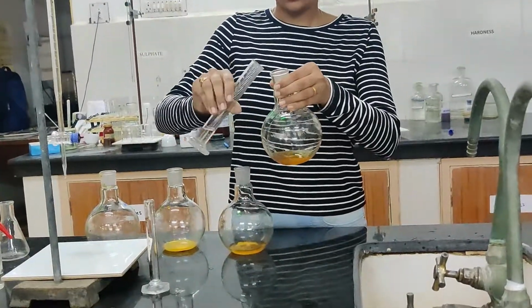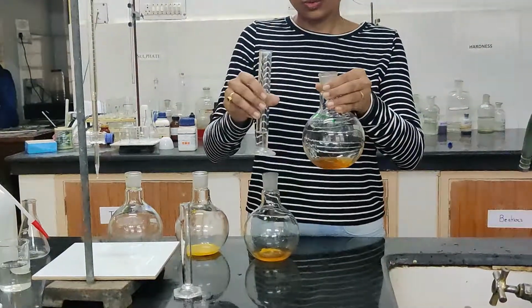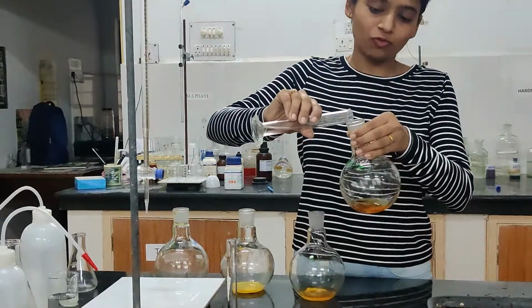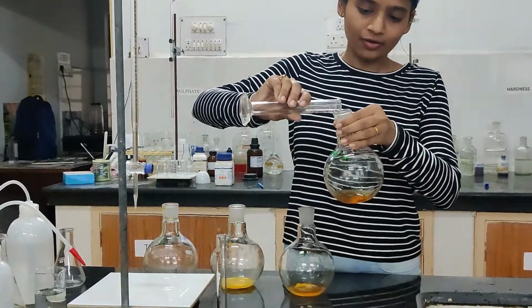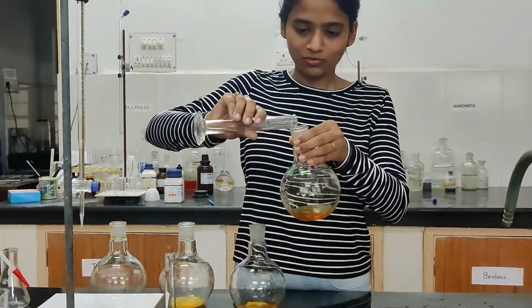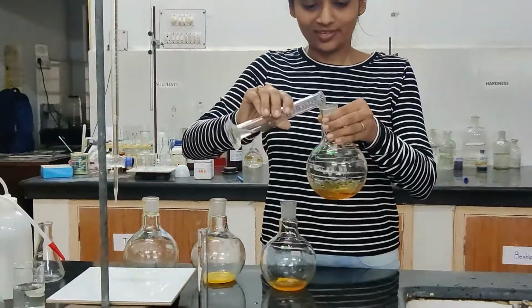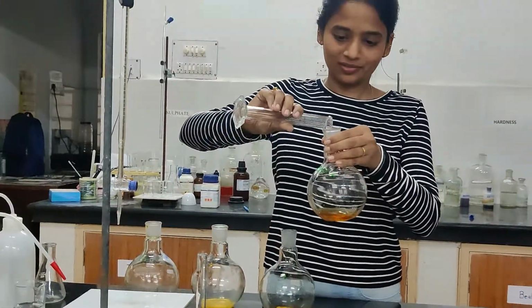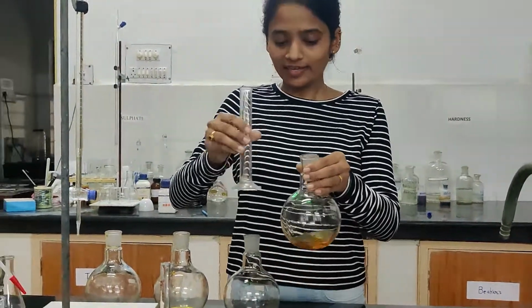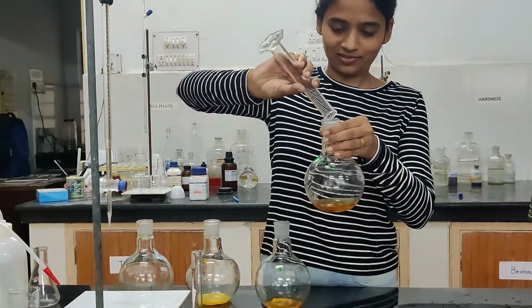I don't know if you people know this or not, but do you know the sequence of mixing acid and water? Should we add water to acid or acid to water? So you will search for this, and with the reason. If we are adding the acid to water, then why can't we add water to acid?